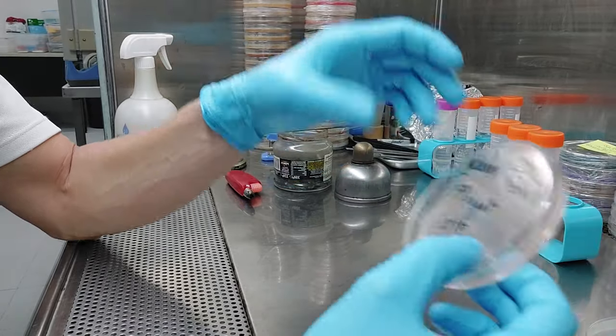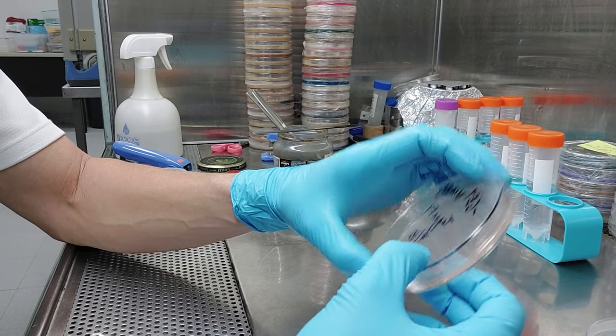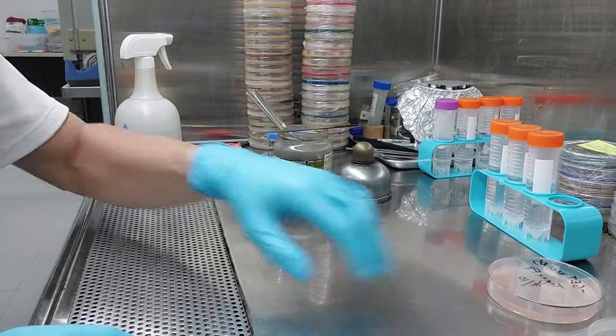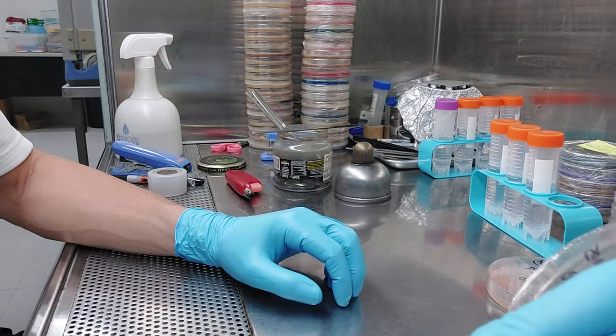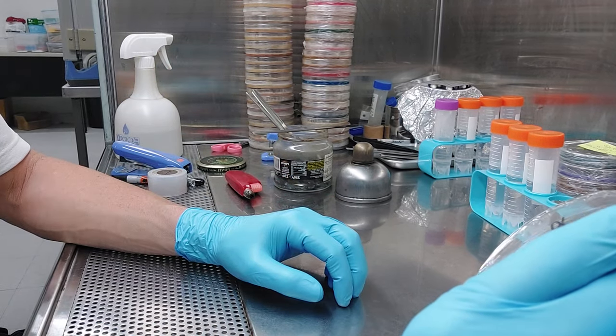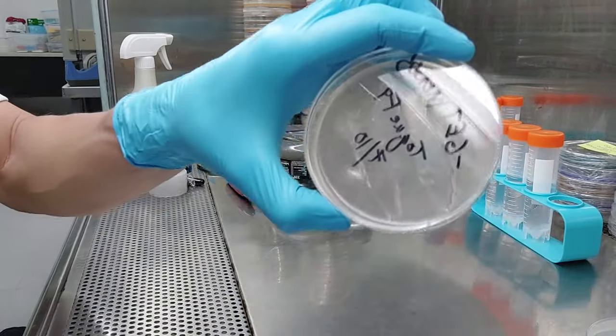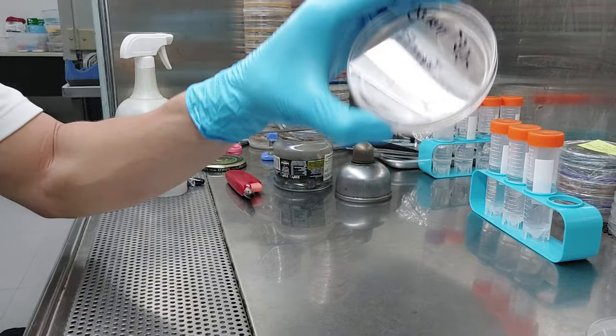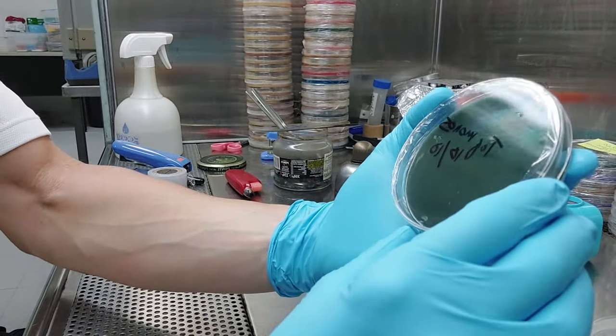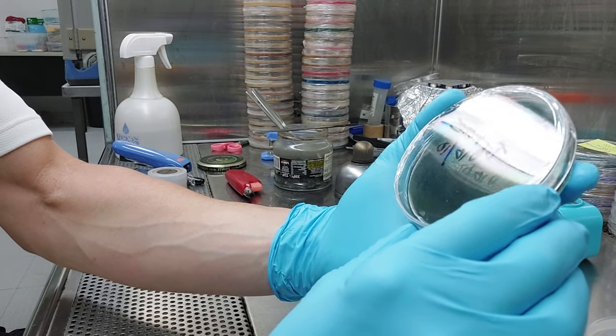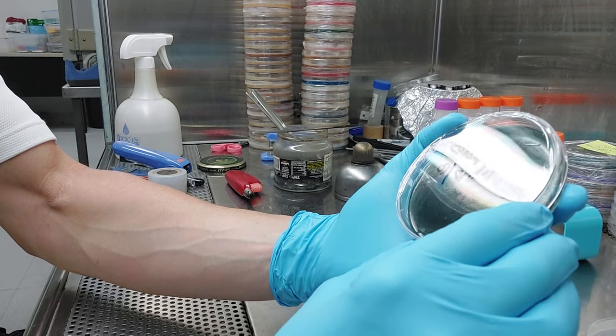Unfortunately that was pretty much this weird pink color plate. So I would use darker colored plates and also make the agar a little bit stiffer. It'll be easier. I usually maybe only pick three or six, but this time I decided, these look like some of them have already grown together. It's really different every time. One of these eight will hopefully be a monokaryon. Remember, you only need one, and that can mate with all the other 36 monos I've got.